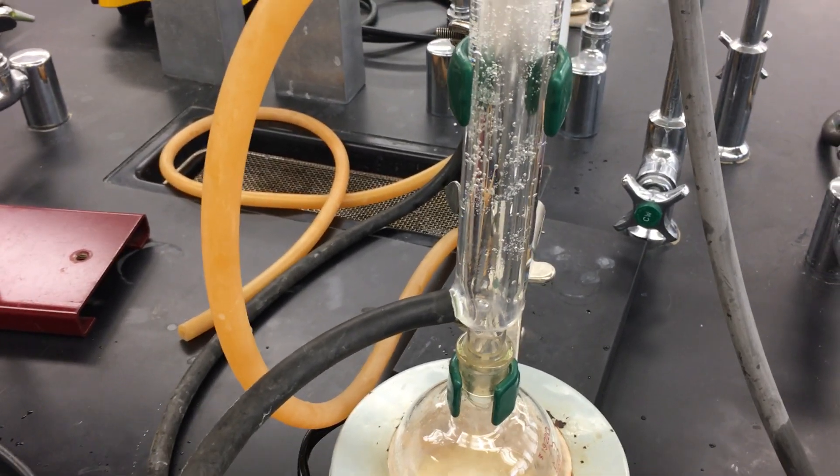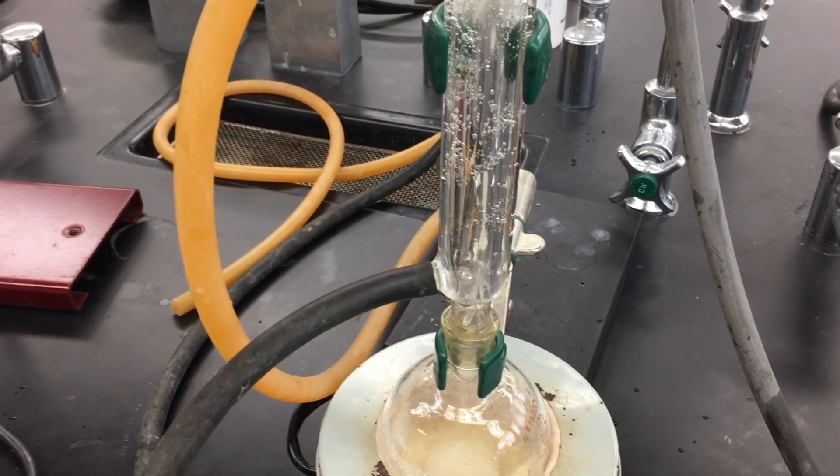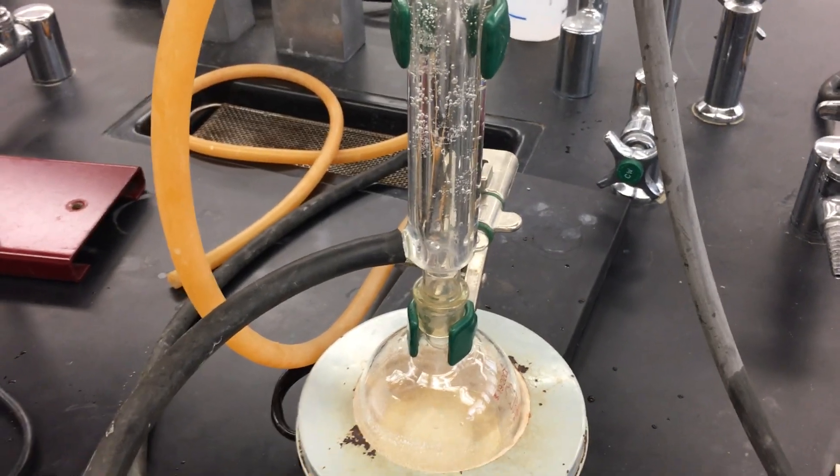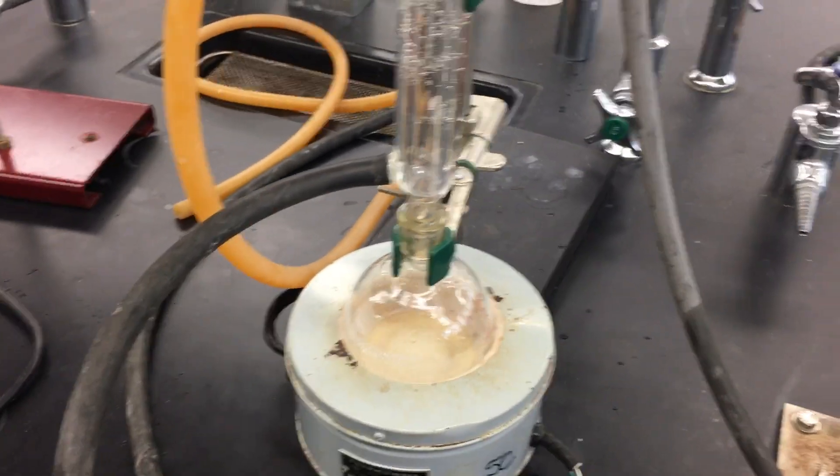Once we isolate it, we will subject it to spectroscopy, NMR spectroscopy, and there we will verify the purity of our product.